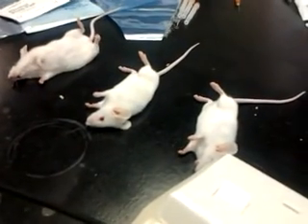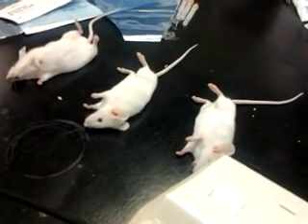Maybe the dose of 0.3 is too high. It's choking. Doesn't matter, we'll do one more. We have to get the right dose.